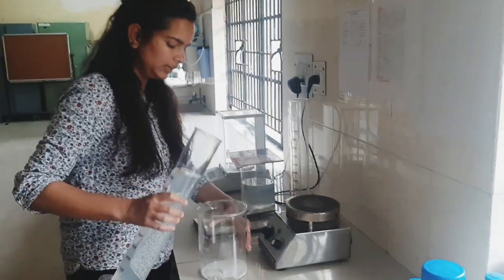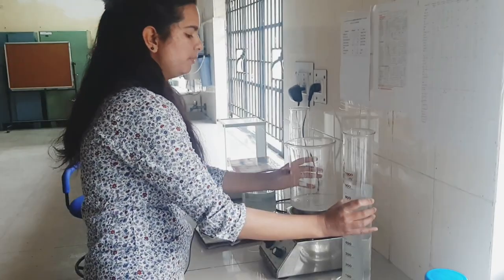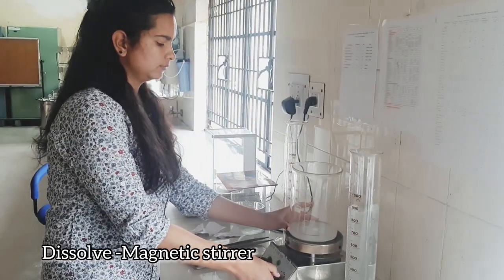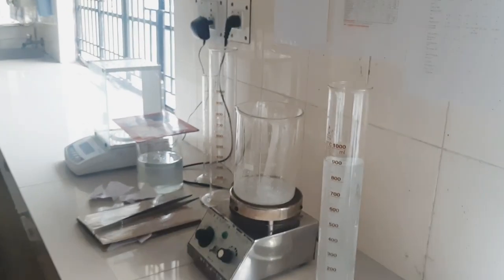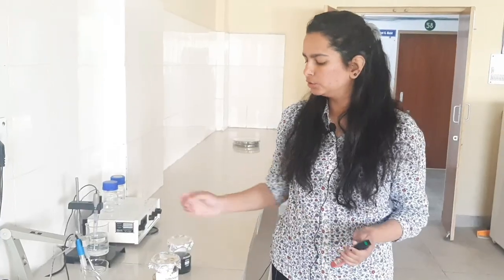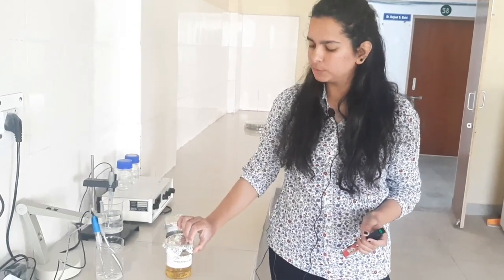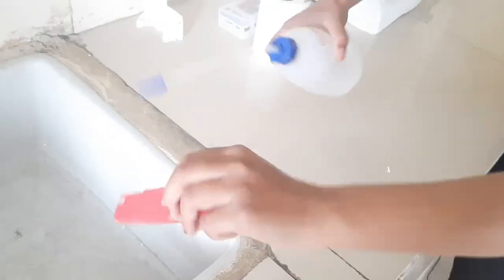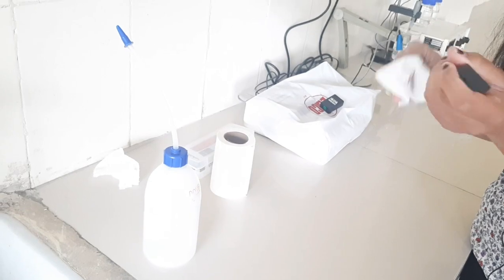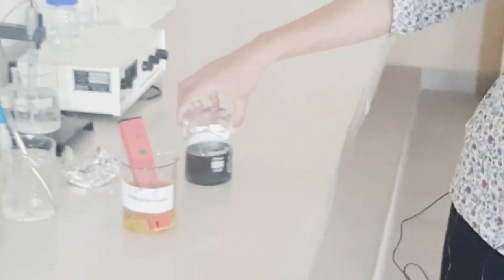Now we will take 100 ml stock solution and we will dissolve it in the magnetic stirrer. Now we have to take a buffer solution — pH 4 and pH 7. First, we will calibrate the pH meter in the buffer solution. Now we will leave it for calibrating, then calibrate it in pH 7.